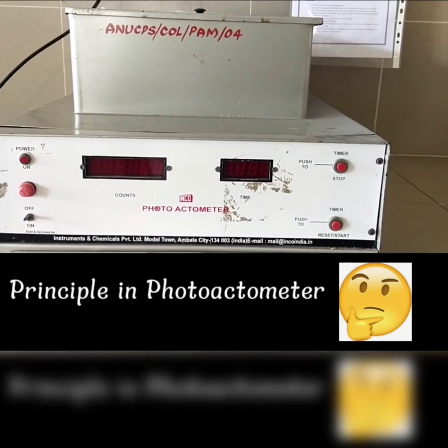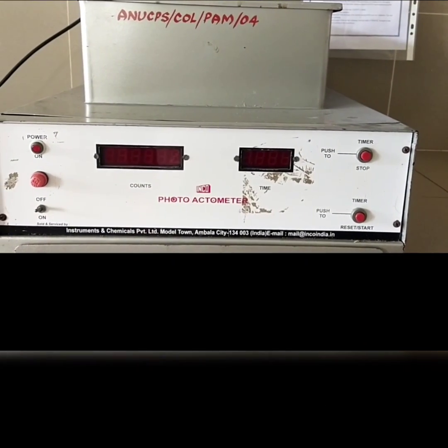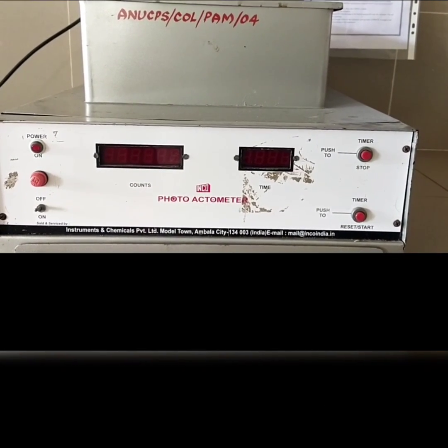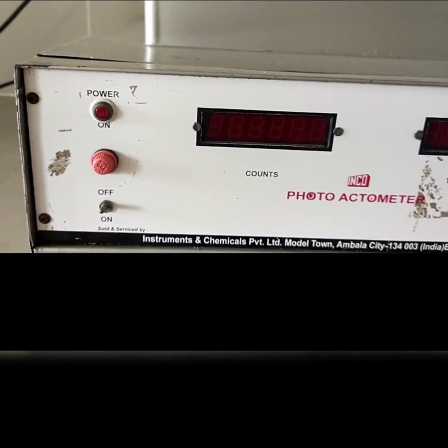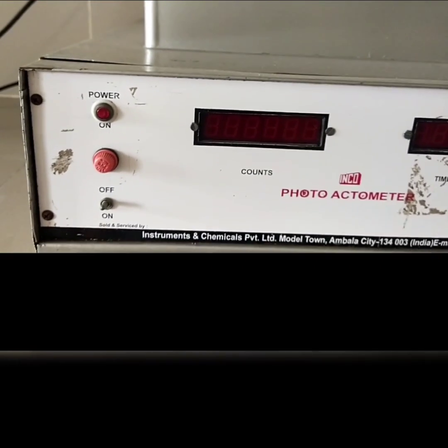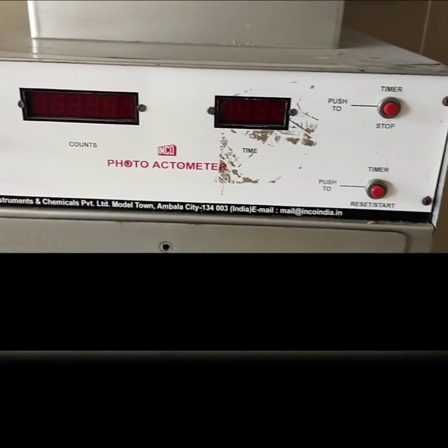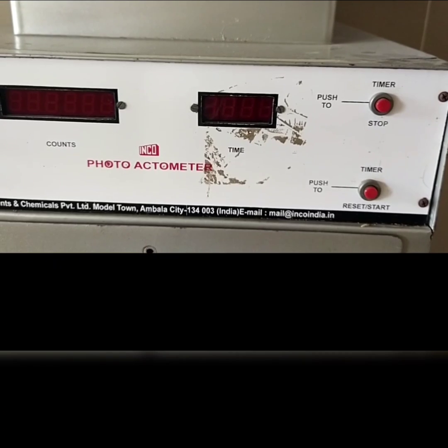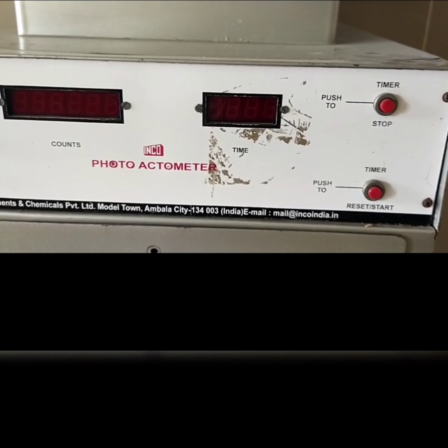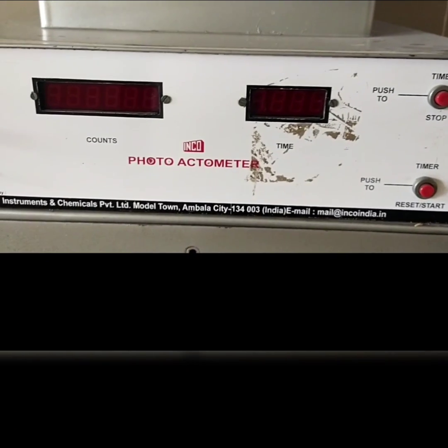What is the principle involved in the photoactometer? It operates on photoelectric cells which are connected in a circuit with a counter. When a beam of light falling on the photocell is cut off by the animal, a count is recorded.